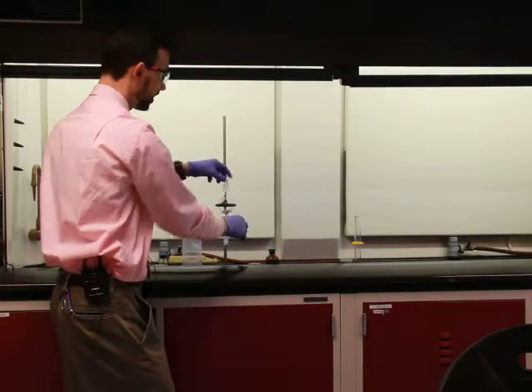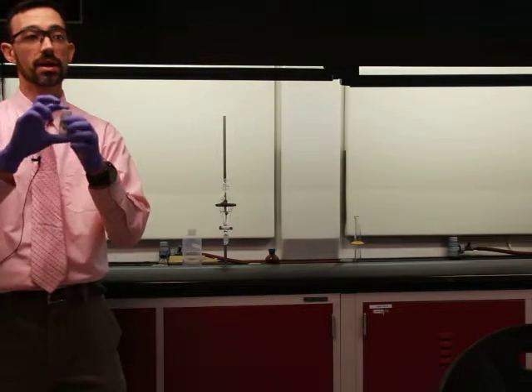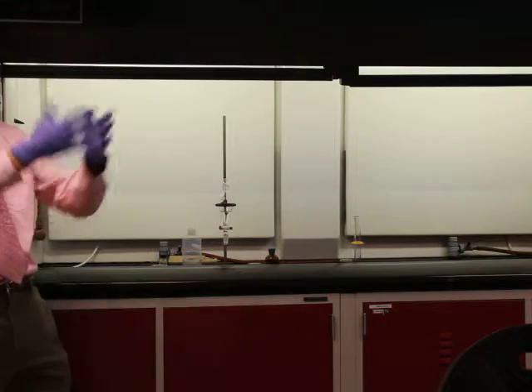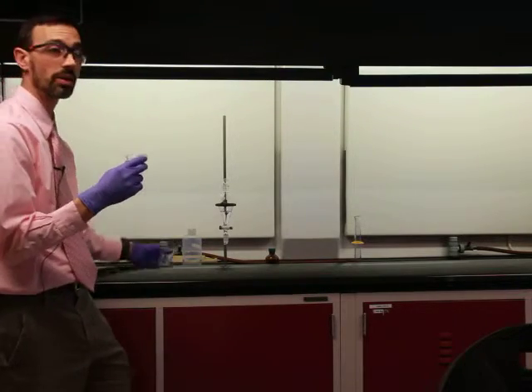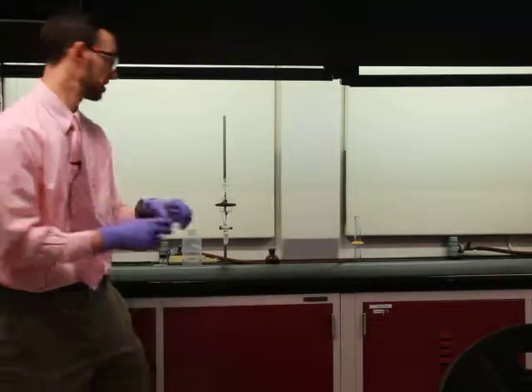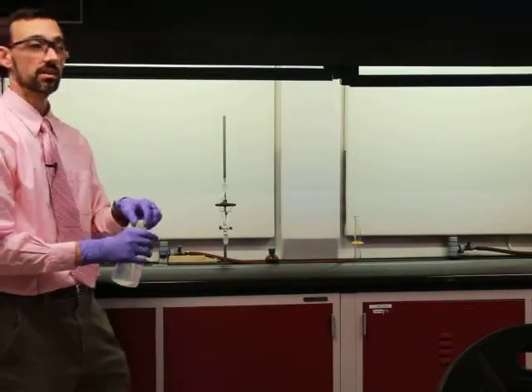So now here's my quandary. Both my acidic compound and my neutral dissolved into the ether right now, but I want them separate. Ideally, at the end of this, I would like to have in one beaker the acid component molecules, and in another beaker the neutral component molecules. That's the goal of this lab. Enter the sodium hydroxide. All right.